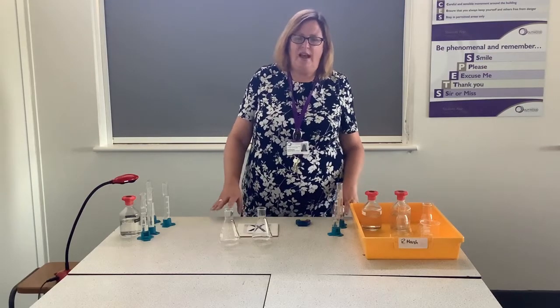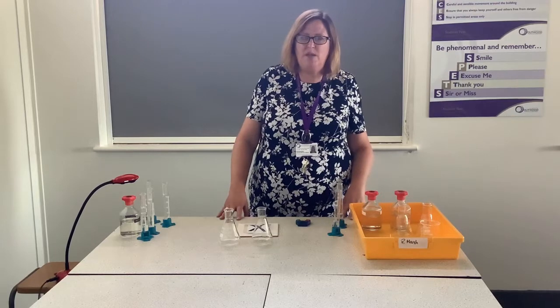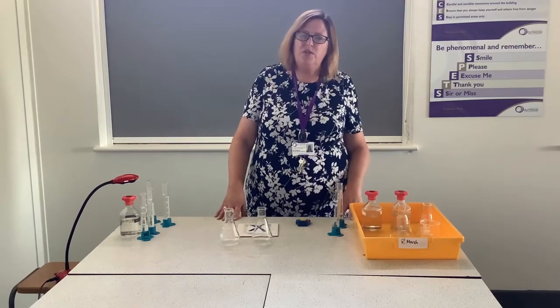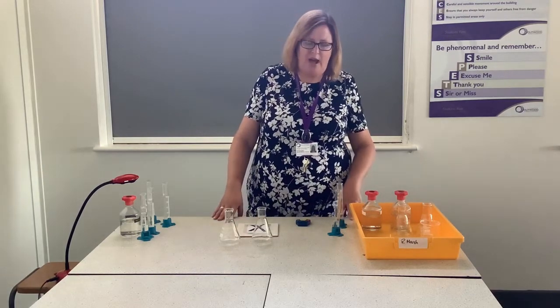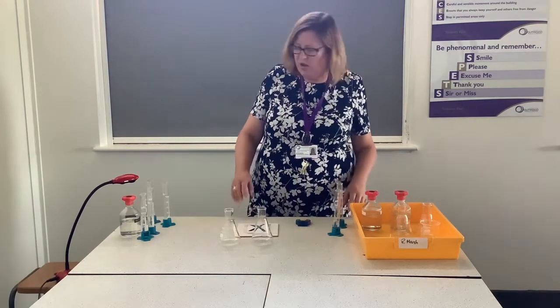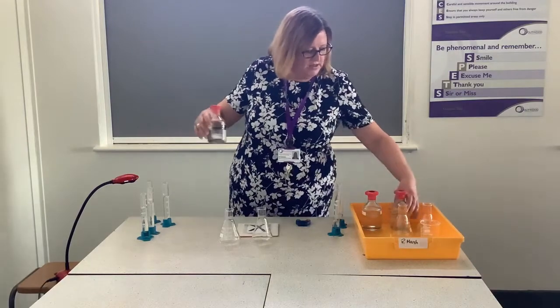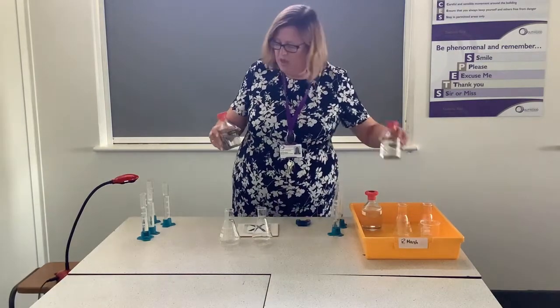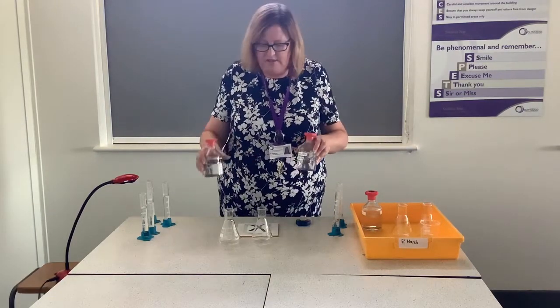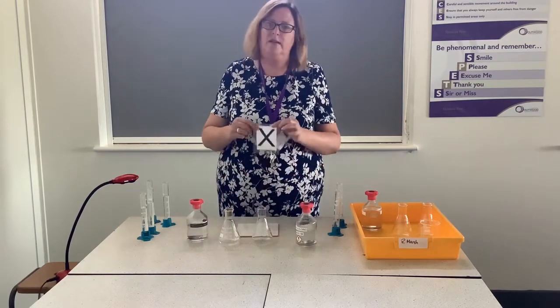Hello, my name is Mrs Chilton and I'm going to be demonstrating one of the required practicals to do with rates of reaction. You need to know two different practicals for rates of reaction, and this first one involves two chemicals. We're going to be using hydrochloric acid and sodium thiosulfate, and this is known as a disappearing cross reaction.